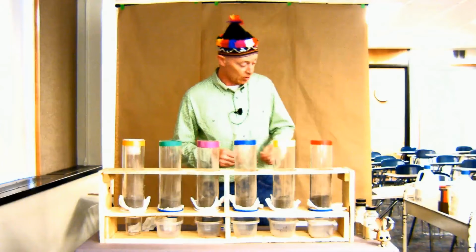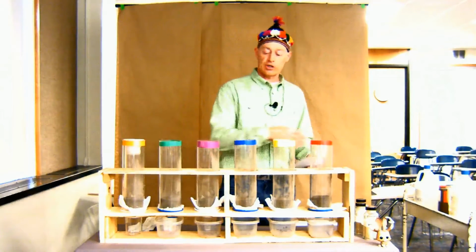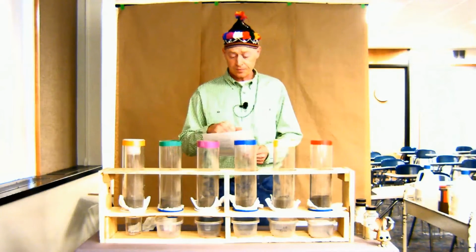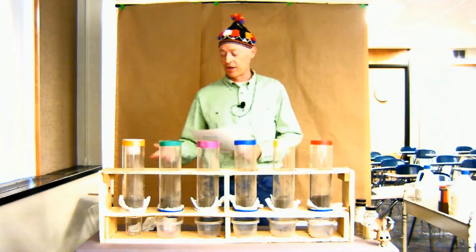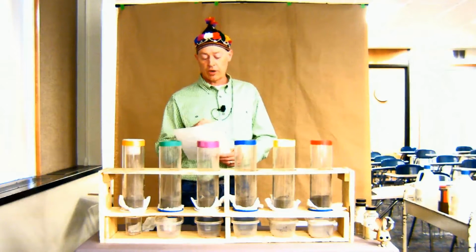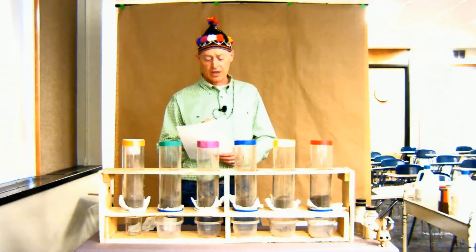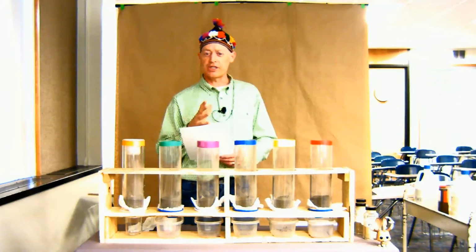So what we have in our treatments, and I got to get these started so they get moving. In the first one, the orange, we have a soil that is sodic. It has a high SAR, a low electrical conductivity. When I say high SAR, it's about 13, 14. And it has a low electrical conductivity, meaning it has about 1 or 2 EC 1-to-1.